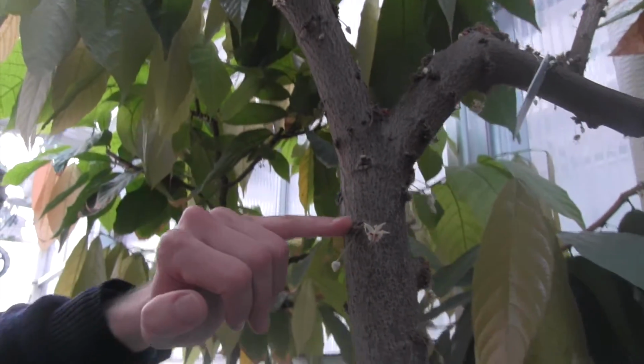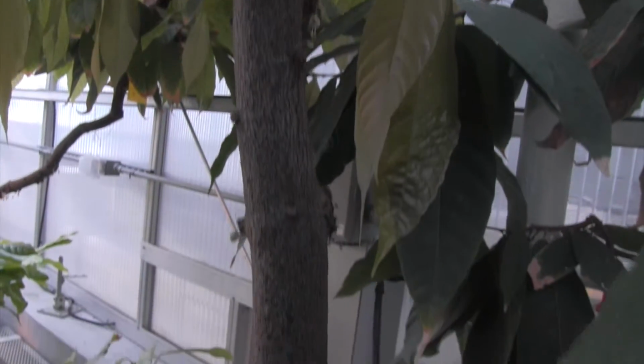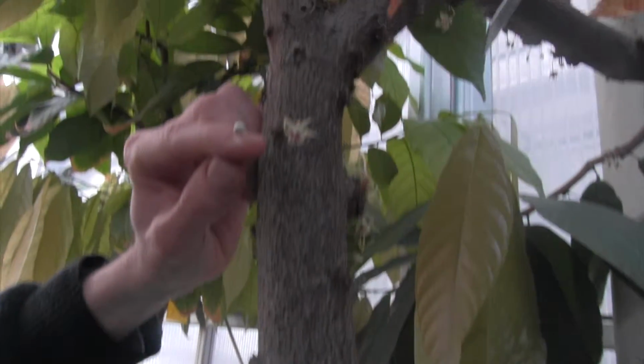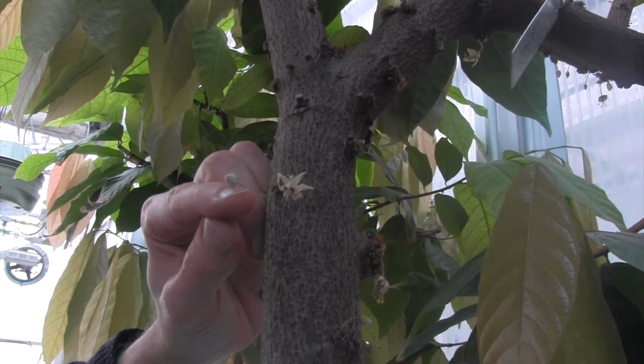Where the stem is connecting here is called a flower cushion. When we start the cell culture or the tissue culture, what we are cutting are these flowers that have not opened yet. Okay. And usually inside, they're still sterile.